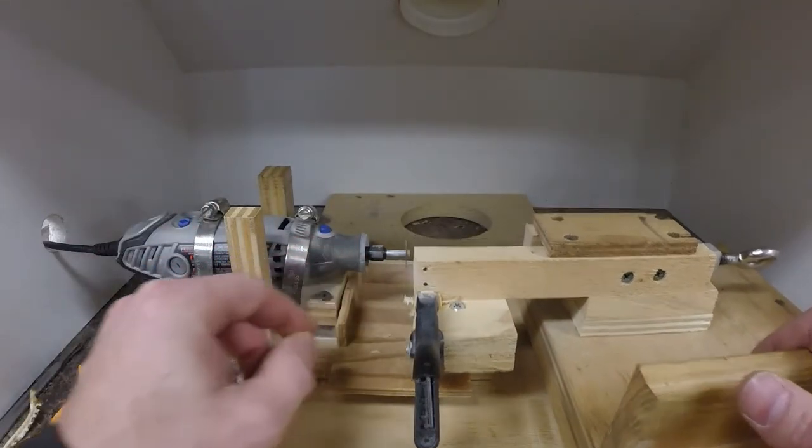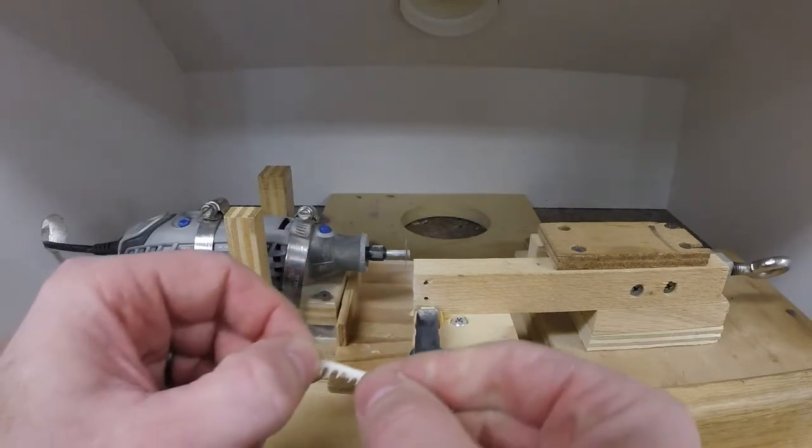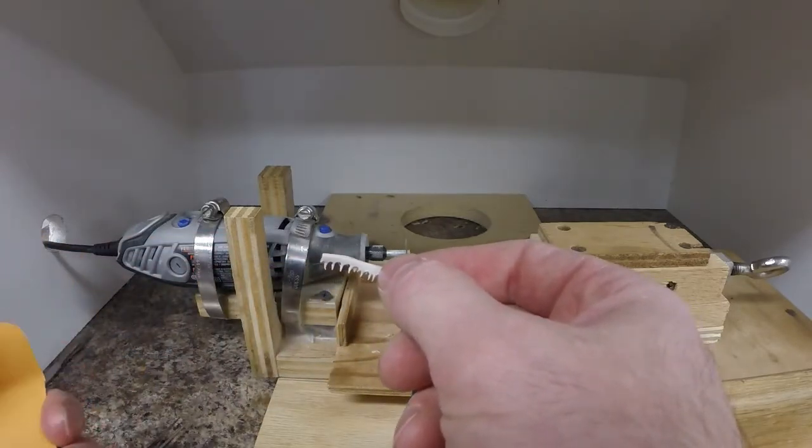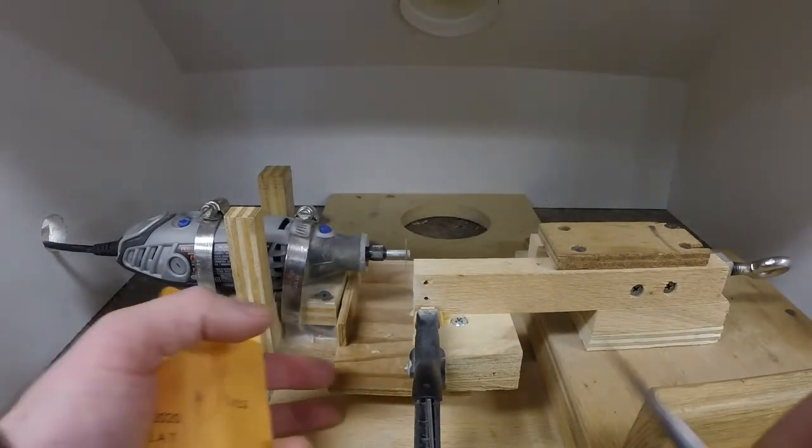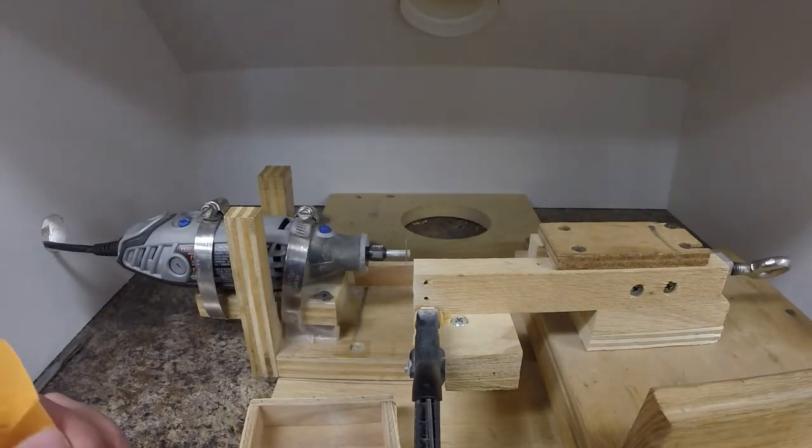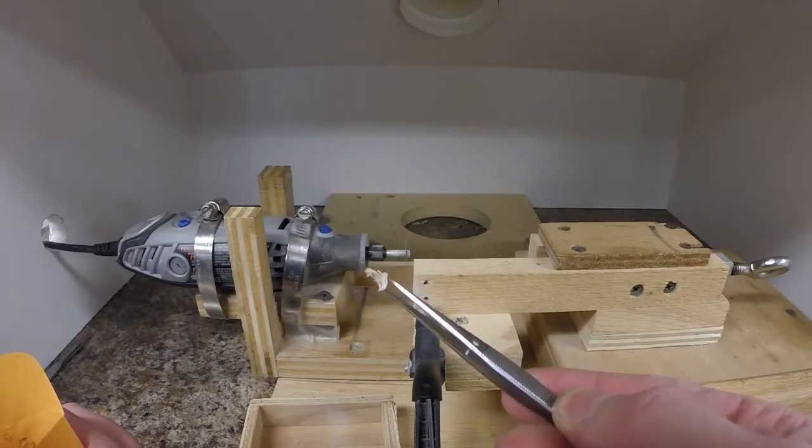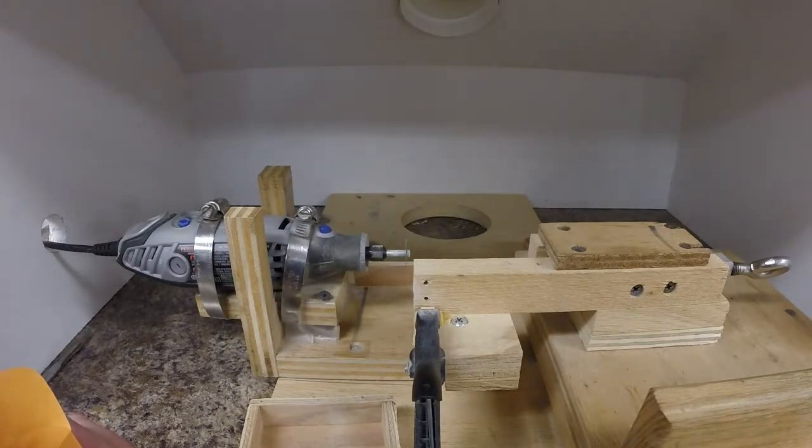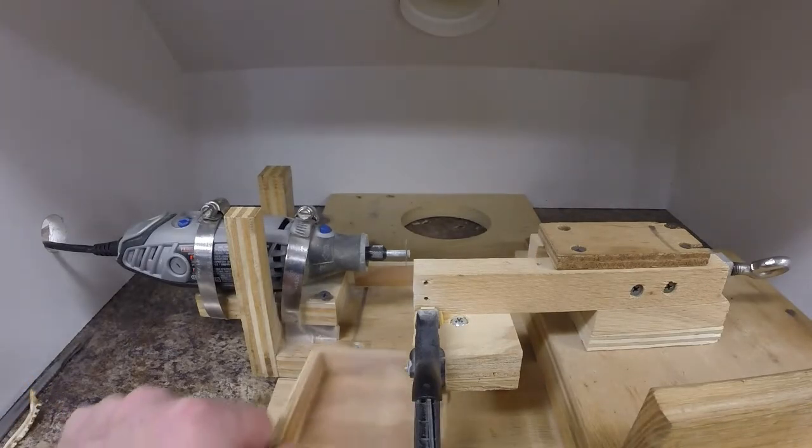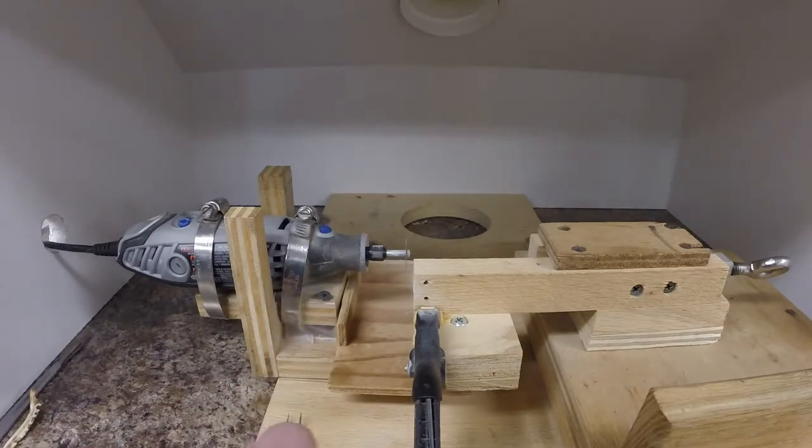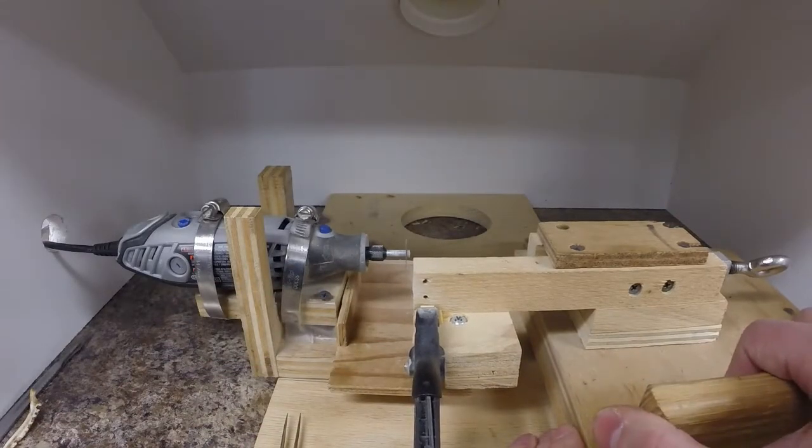And that gives us our three sections. We save the remaining portion of the maxilla just in case we need to take another cut later on if we don't like the sections we got. The knuckle we don't use that for anything, so we toss that.